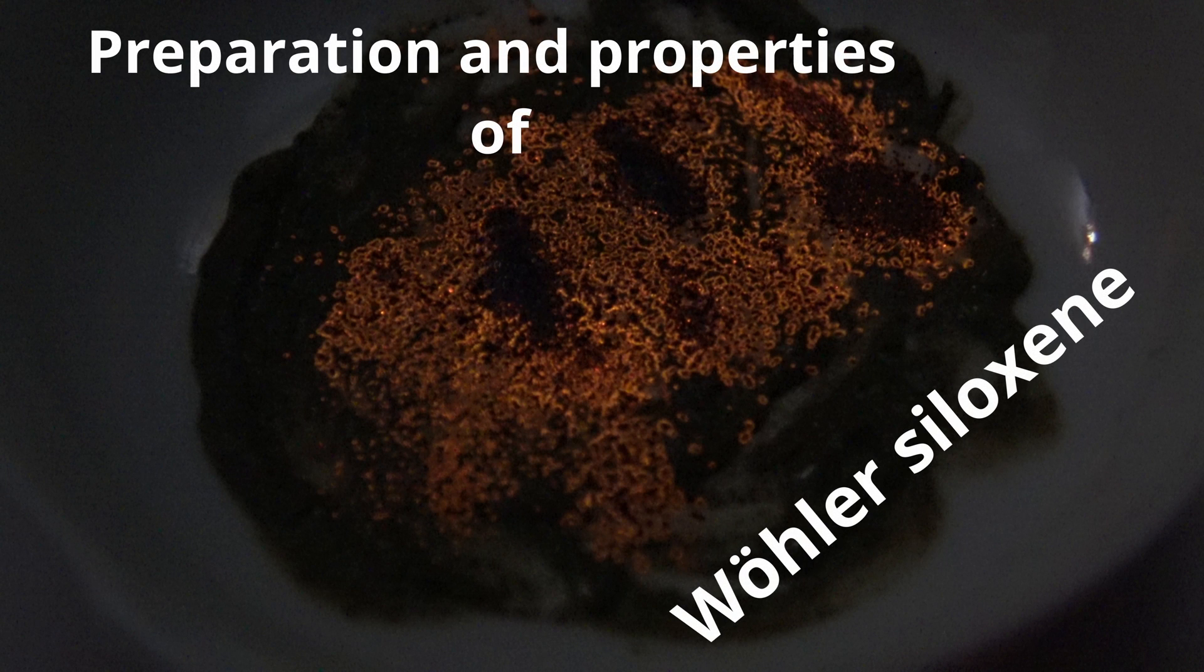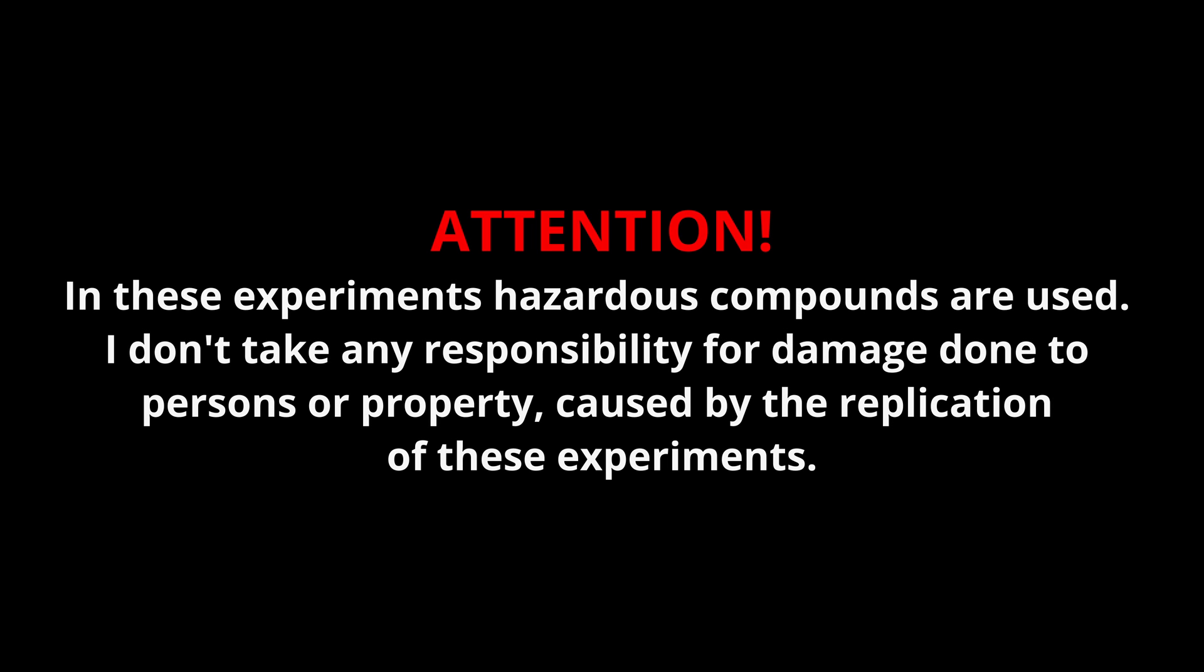The preparation and properties of Wöhler siloxene. In these experiments, hazardous compounds are used. I don't take any responsibility for damage done to persons or property caused by the replication of these experiments.